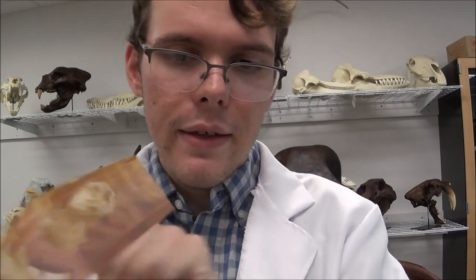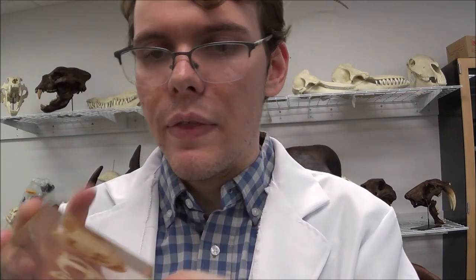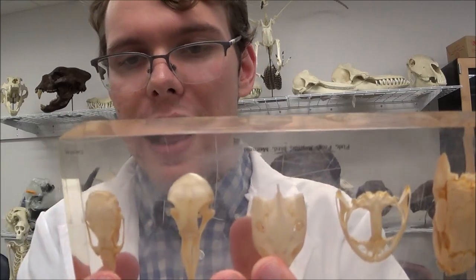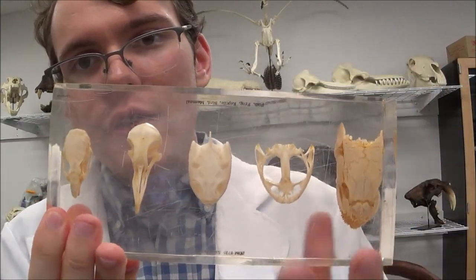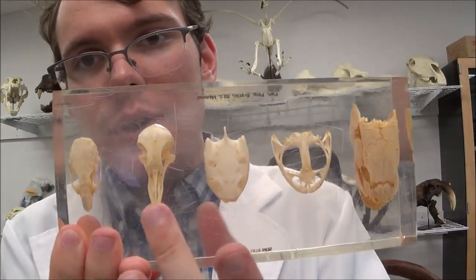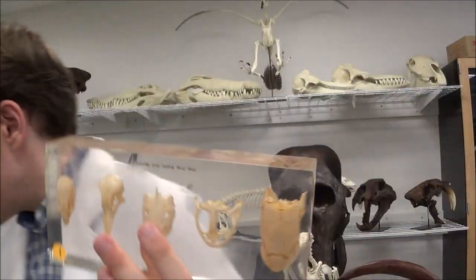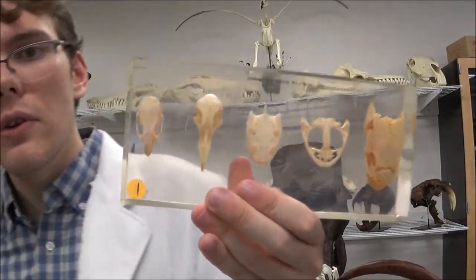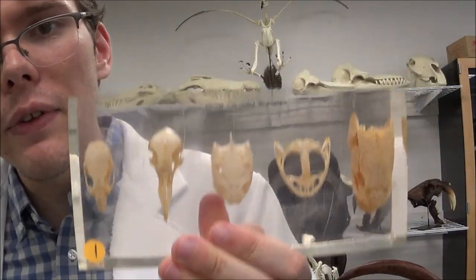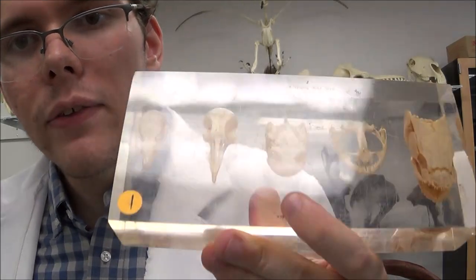Actually, I think this might be a rat — this is a rat. So you have fish, amphibian, reptile, bird, and mammal. Take a look at those and note their differences and their similarities.